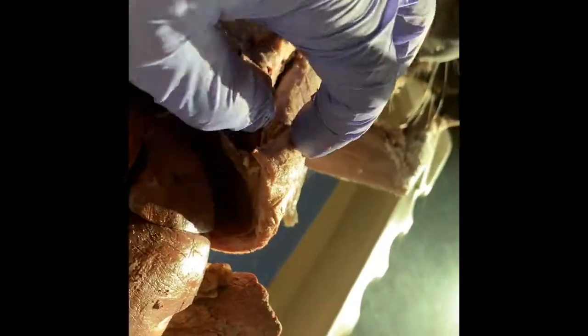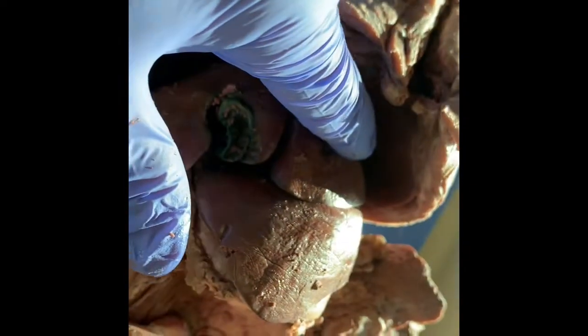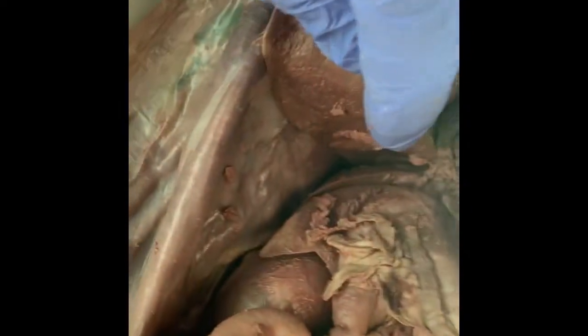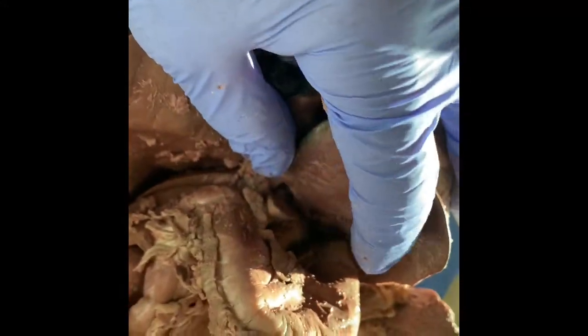This is also what spasms when you get the hiccups or when you get the wind knocked out of you. It's this muscular wall that's the culprit, okay? Here's a close-up of the gallbladder. You can see it has a green appearance, and that's from the bile. Again, this is the right medial liver lobe, left medial, left lateral, right lateral down here, and then the caudate lobe is this little one right underneath there. You guys see it looks like a little tiny kitty tongue.